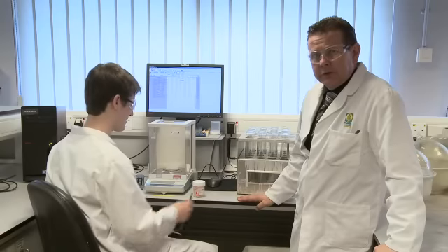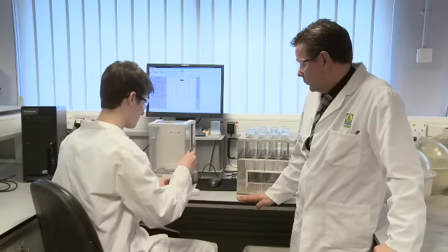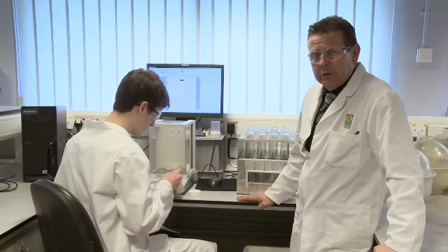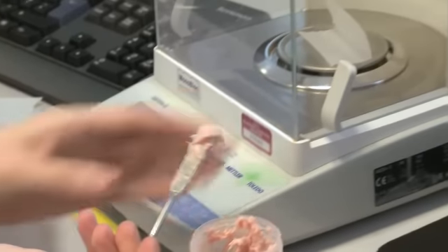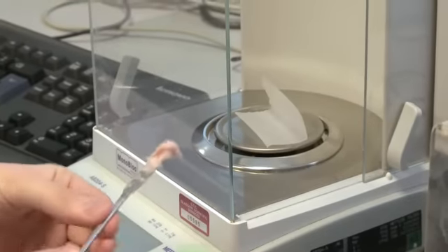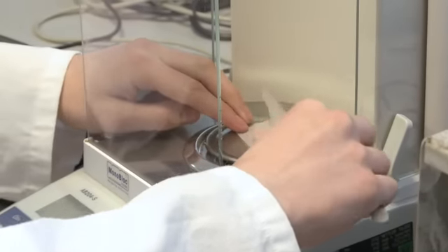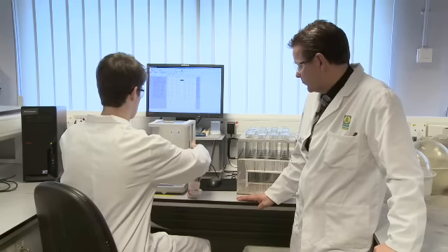After the homogenising process, we can now carry out the nitrogen determination on the sample. The nitrogen content is related directly to the protein content associated with the meat and also related directly to the meat content of the sample. The sample is weighed onto a suitable piece of paper, the weight requiring to be known to 4 decimal places.